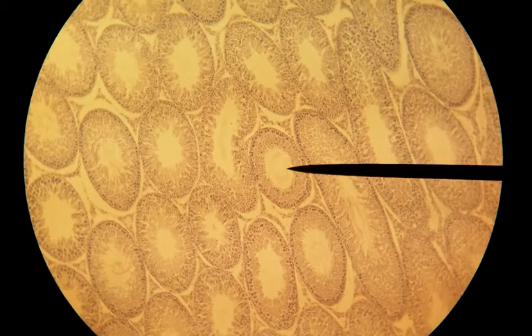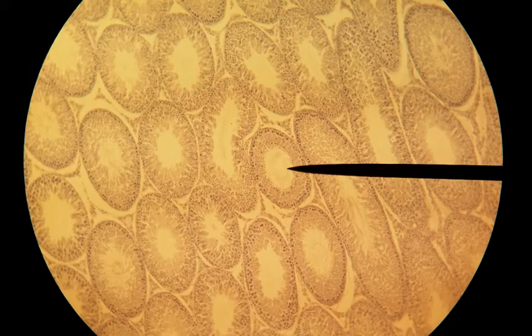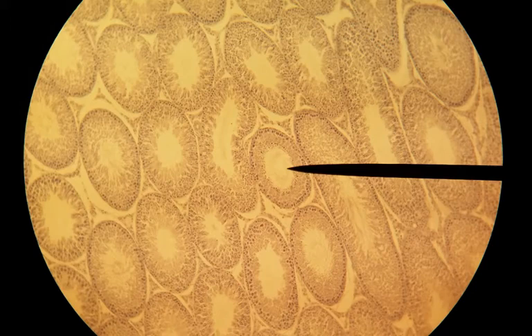Hello. Welcome to the second half of the slides we're going to need to look at for Exam 3 in Biology 139. These are the reproductive slides. I put the endocrine slides in a different presentation so it's not quite so long. So let's go ahead and begin.